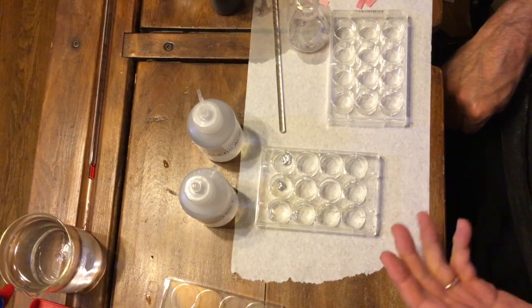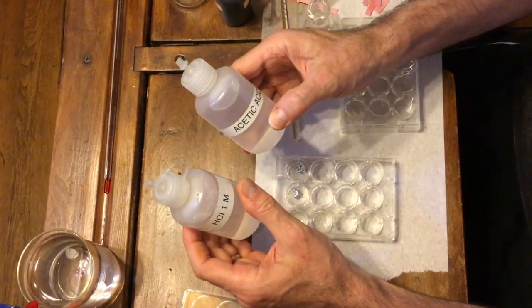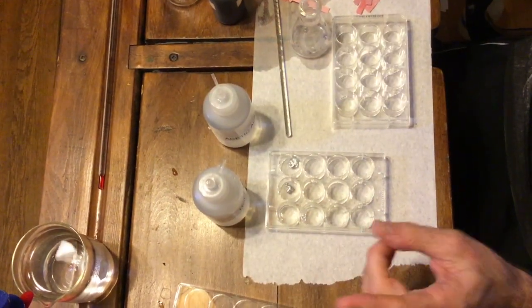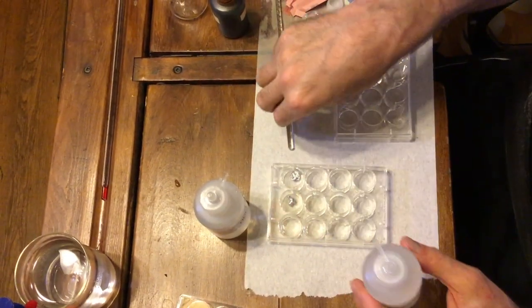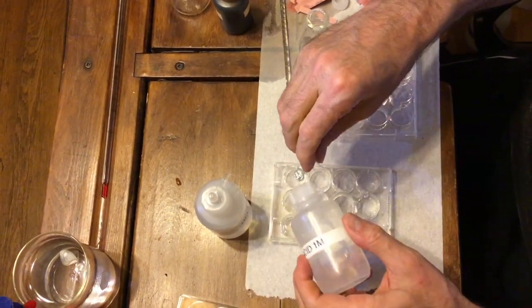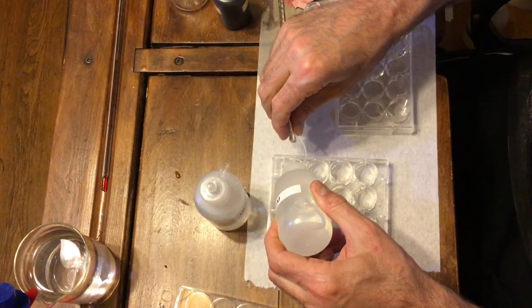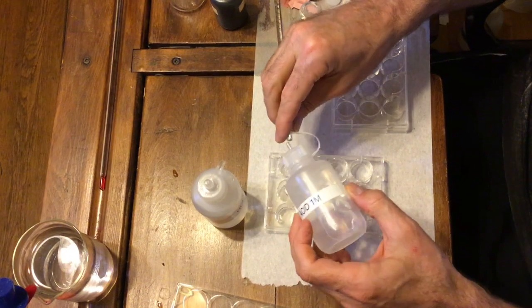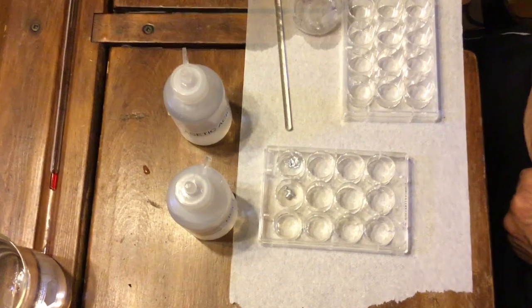Okay, acids react with metals. So I have two acids here. I have a hydrochloric acid and acetic acid, same concentration, 1 molar. Now, you know those are different kinds of acids. So let me put acetic acid and react it with zinc, that's zinc metal, and I want you to observe if these reactions are different. So I'm going to put 20 drops. So there's the acetic acid on the zinc.